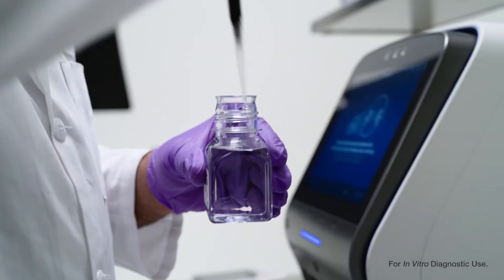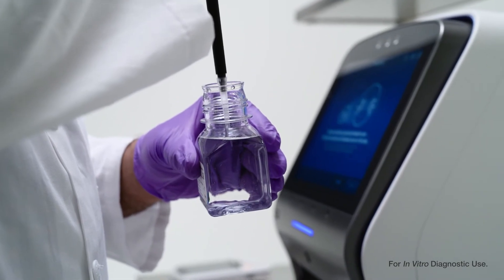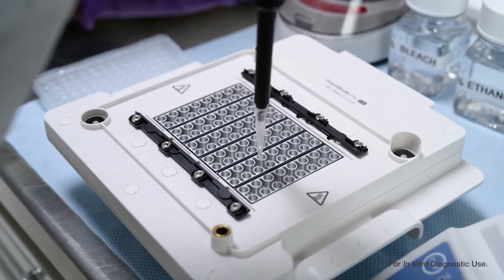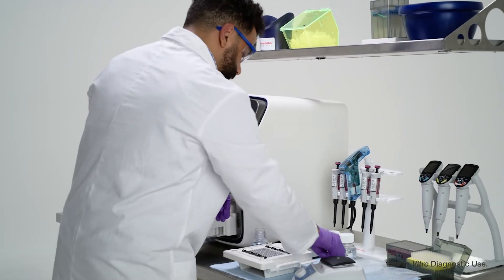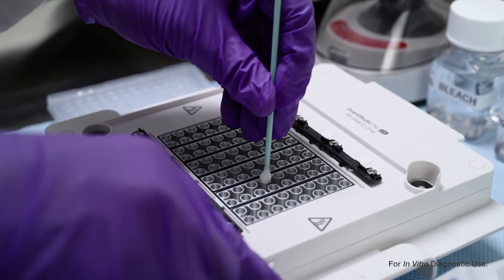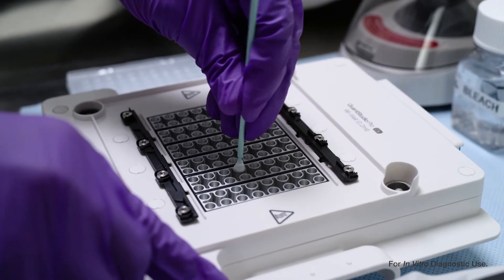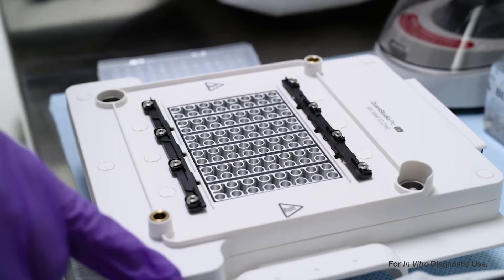Once the block is removed, rinse the contaminated well positions with deionized water. Add 50 microliters of water into the contaminated wells, pipette up and down several times, and remove excess liquid. Then use a lint-free swab to scrub the inside of the contaminated wells. If a high level of contamination is present, repeat the cleaning process with 50 microliters of 95% ethanol.